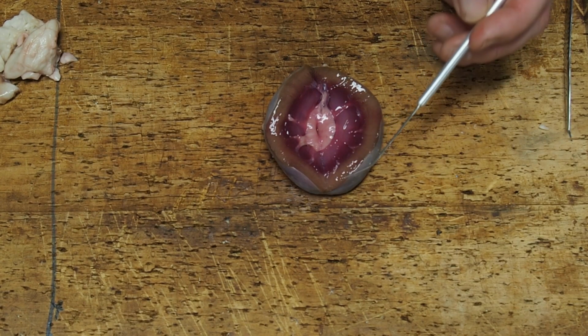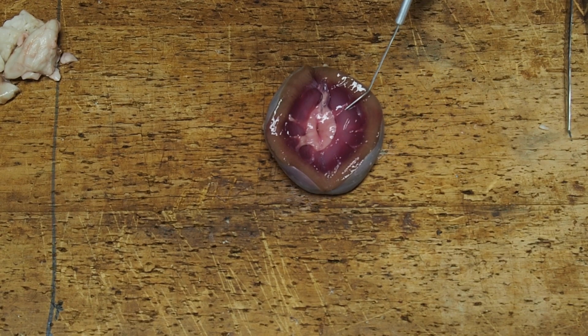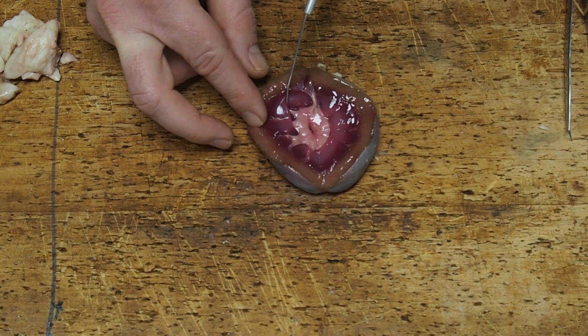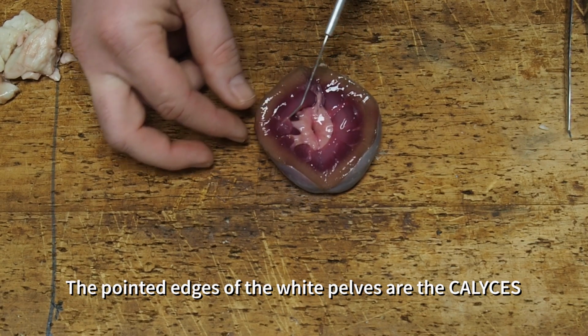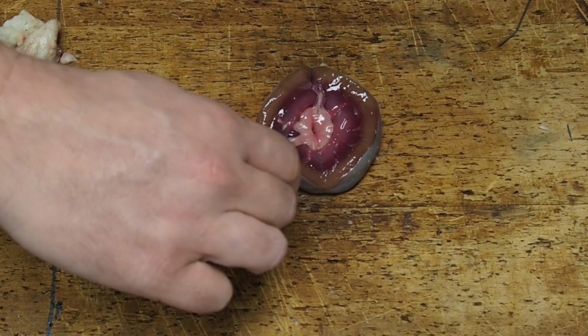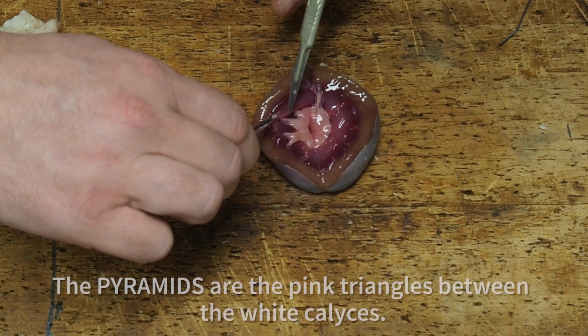So with the kidney laid out flat, we can clearly see the outer cortex, the central pinkish medulla, and then the white inner pelvis here. And the edge of the pelvis forms these pointed structures reaching up in towards the medulla, and they're called the calyces. And then the pinkish medulla comes down, forming pointed structures back down towards the centre. Those are known as the renal pyramids. I'm just showing them here.